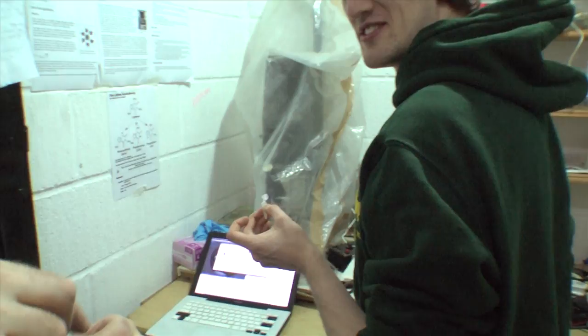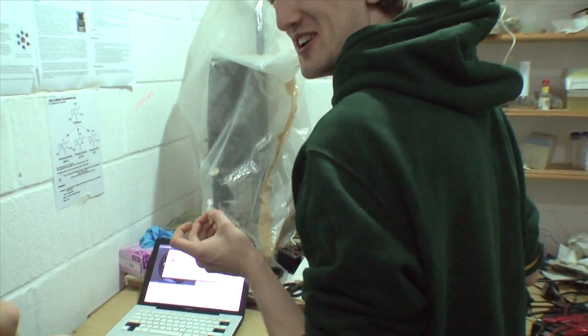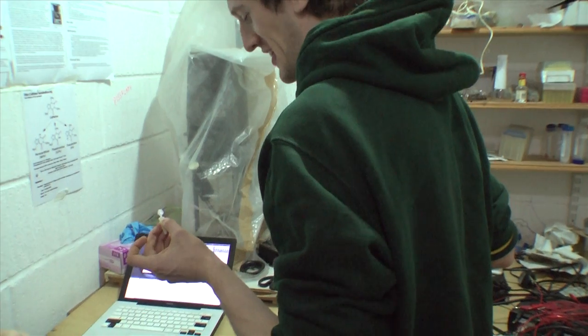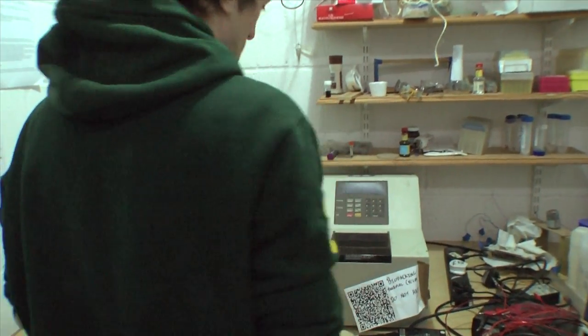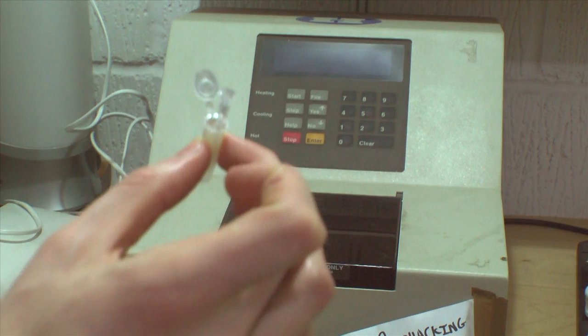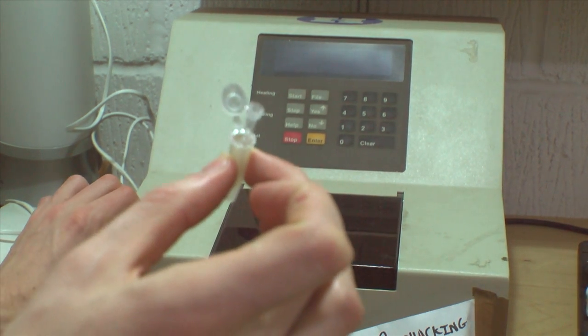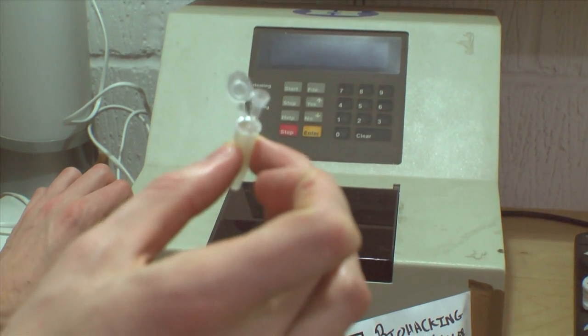What's that noise? That's the thermal cycler. That's the most hacker looking thing in the place. So we're using our thermal cycler, which is just going to keep it at 100 degrees. So we'll just turn it on.